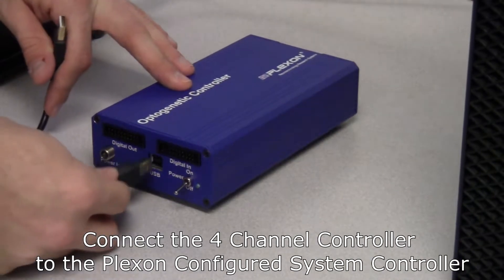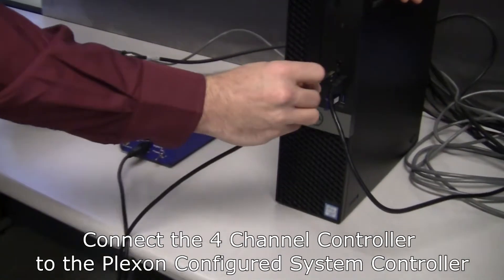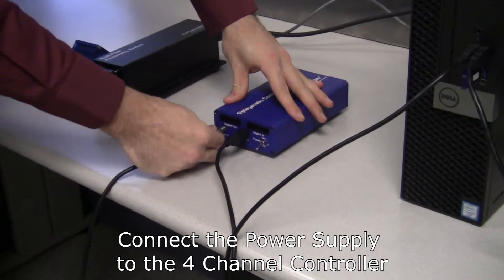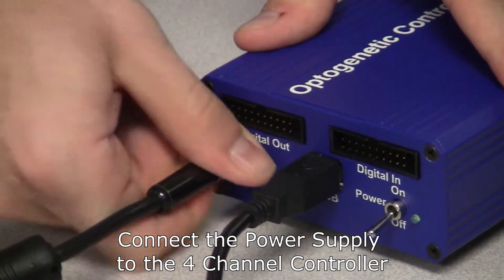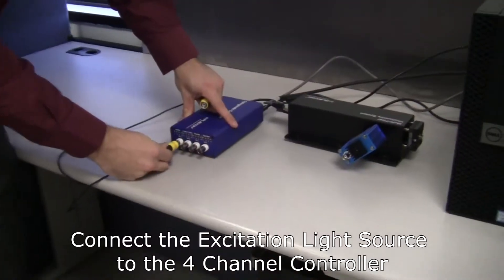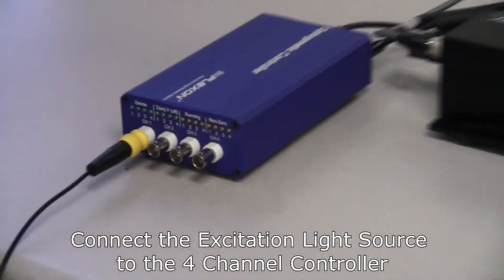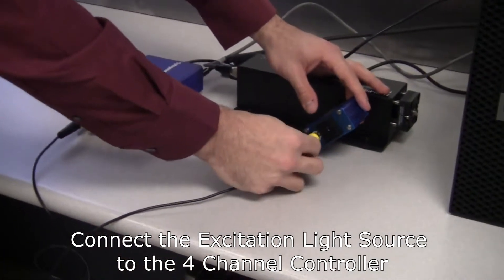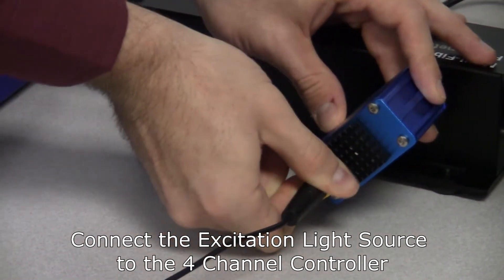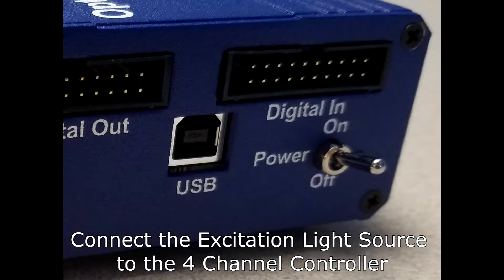Use the USB cable included with this system to connect the 4-channel controller to the Plexon configured system controller. Then connect the power supply to the controller. Next, use a BNC cable to connect the 4-channel controller to the excitation light source. Ensure that the device is connected to a power source and turn on the 4-channel controller.